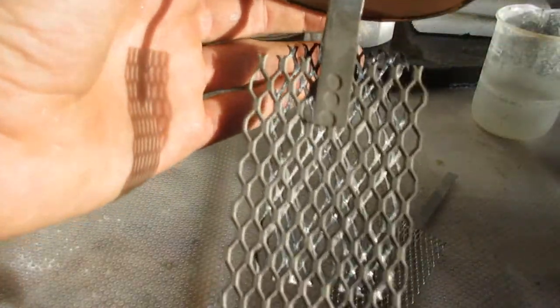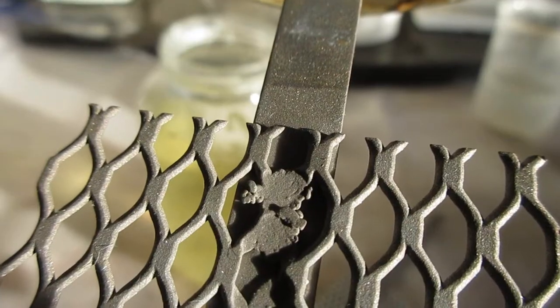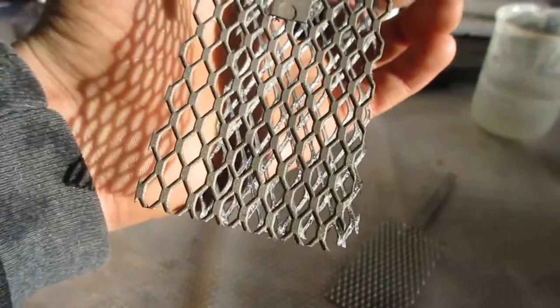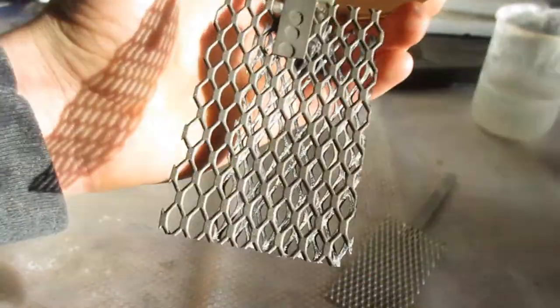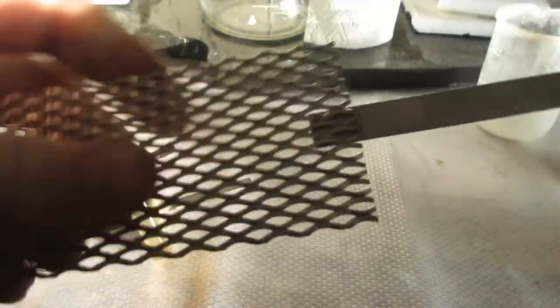Also, another distinguishing factor is usually, you can't see it on this one, but there is often a line where the electrode comes out of the electroplating solution. Like I said, you can't really see it on this one, but there usually is. This one, no line. This is literally just welded, I guess you could say, directly on there. There's no line where it's been dipped in an electroplating solution.